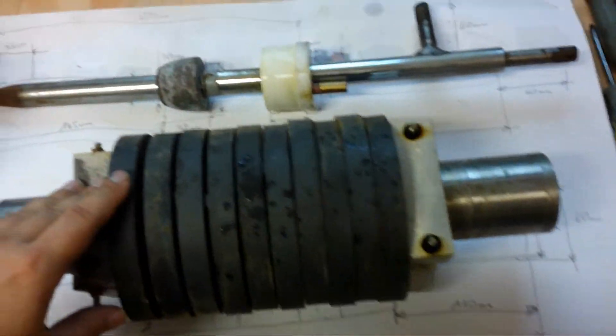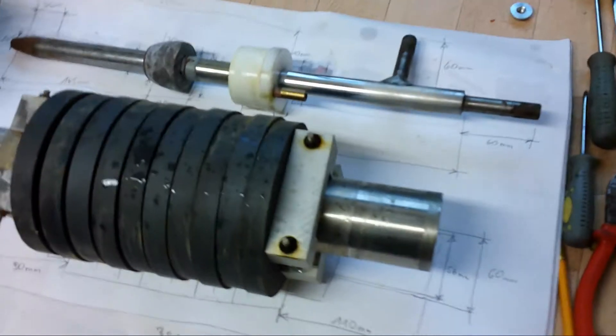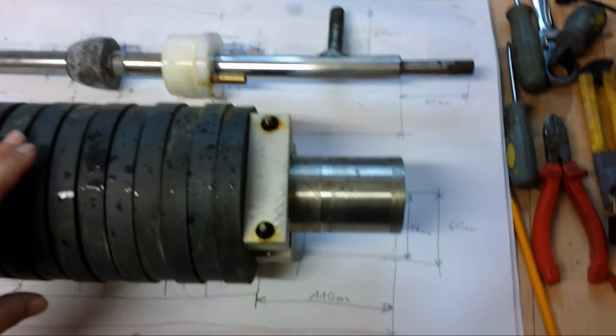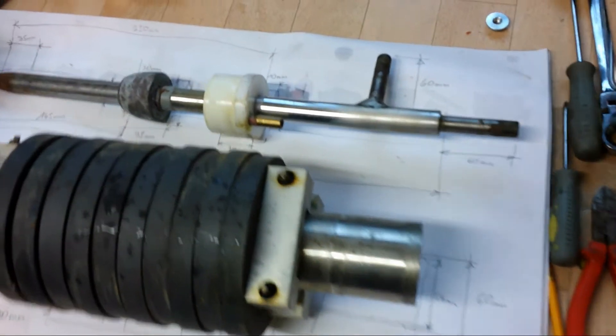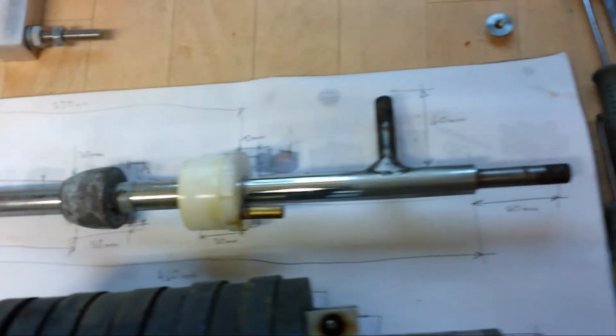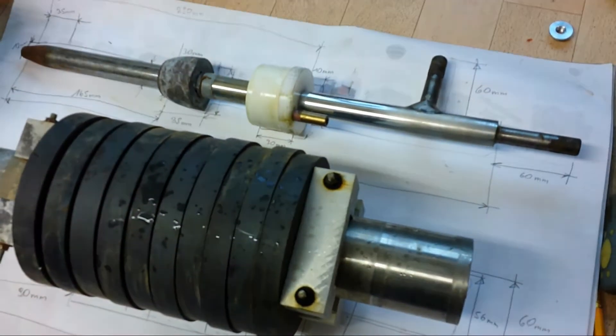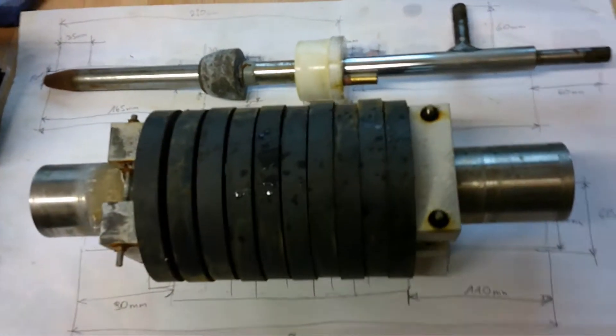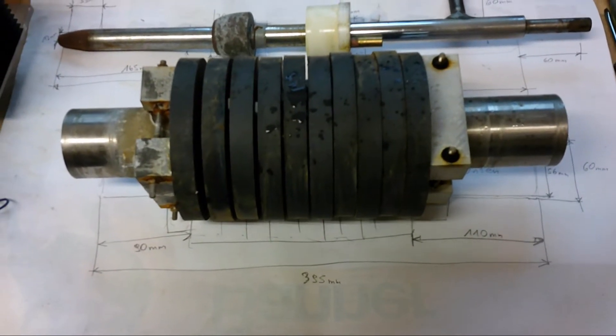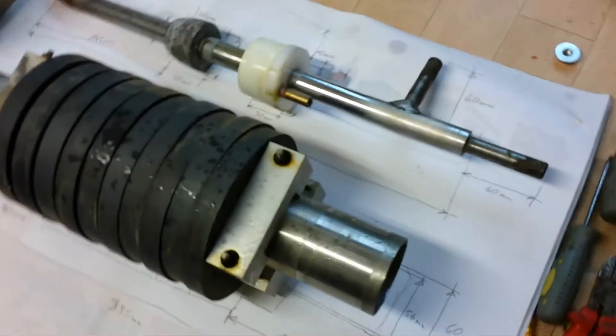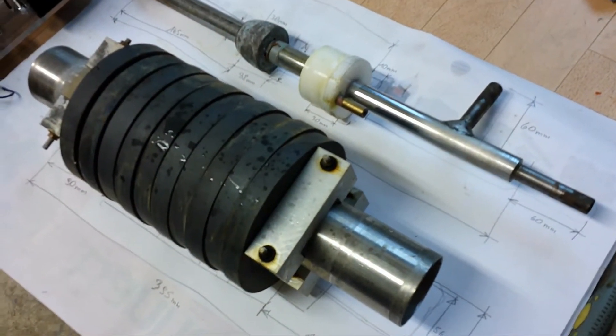So now I took the measures of the two parts. I am going to clean that up. But there are the measures in the background of the paper, and I am going to draw that on the computer to make it easier to understand and easier to view.